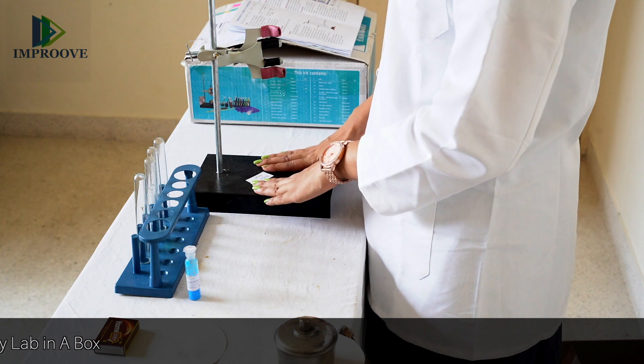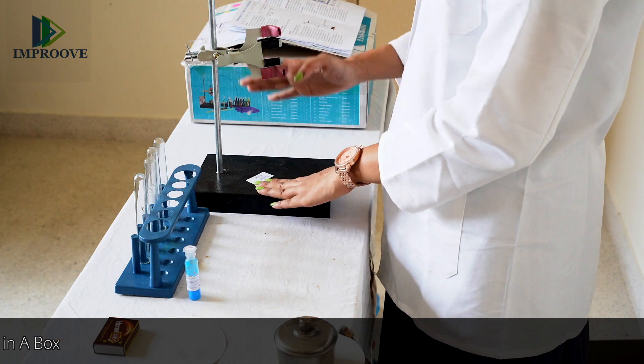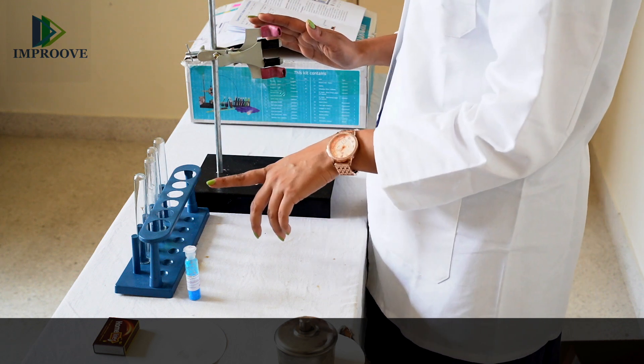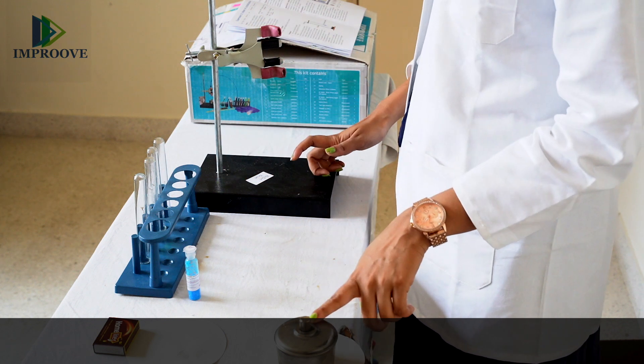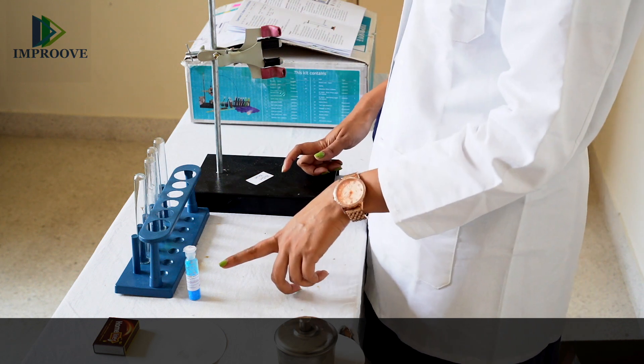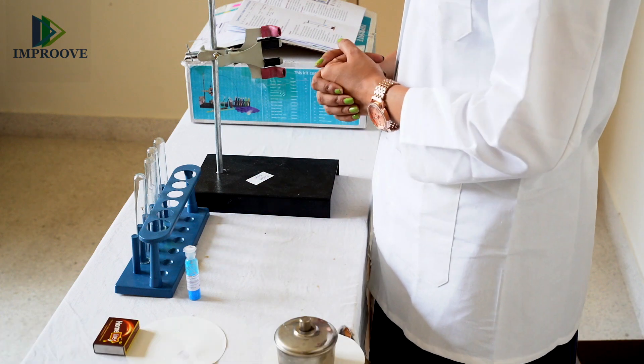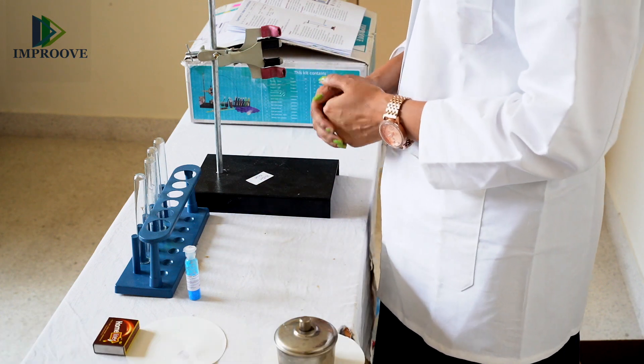For the experiment you will need a retort stand along with the clamp, a test tube, a spirit lamp, copper sulphate crystals, and a match stick to light the lamp.